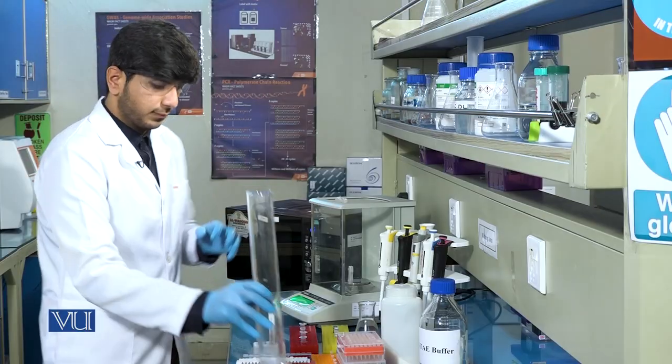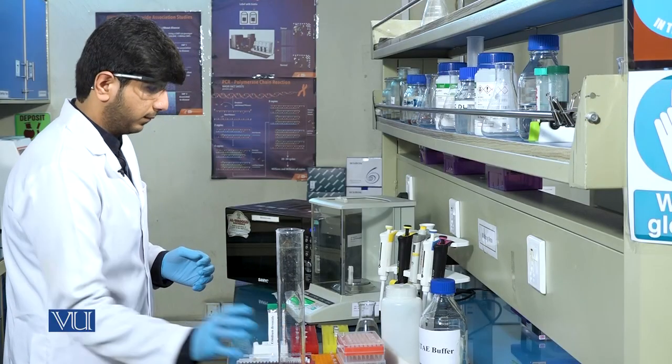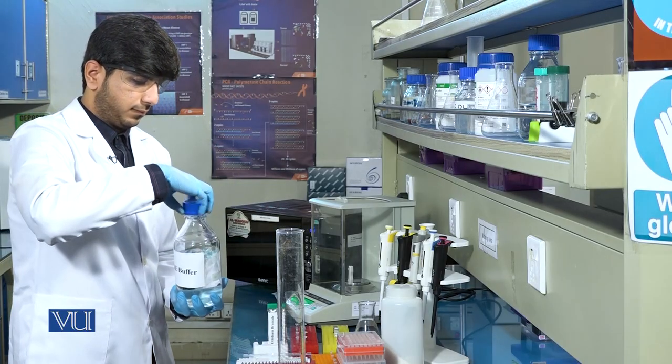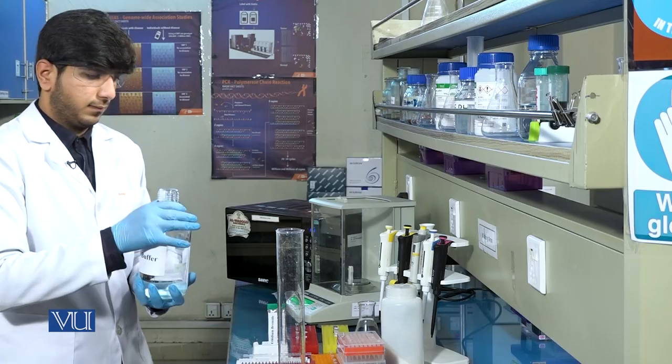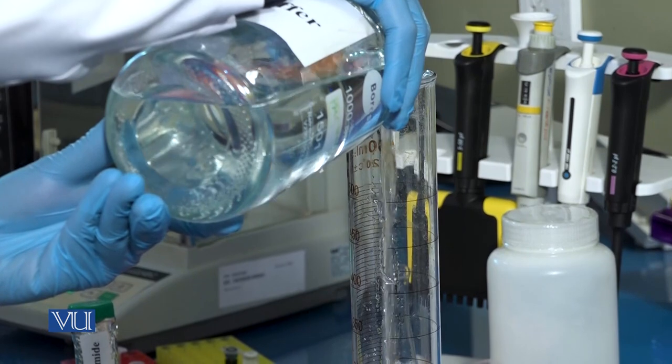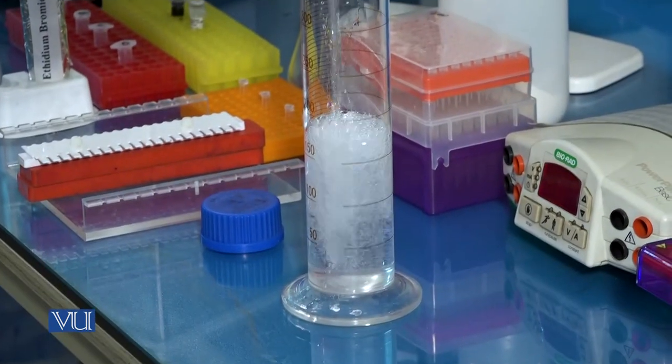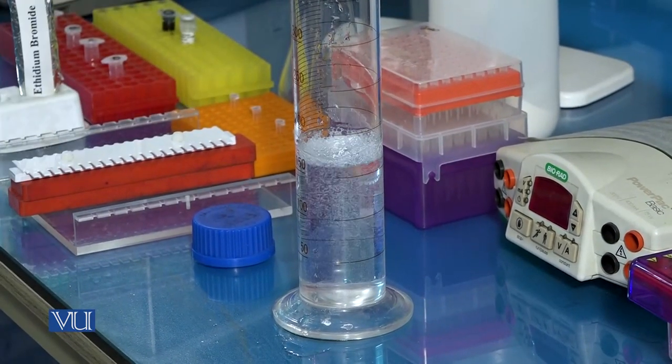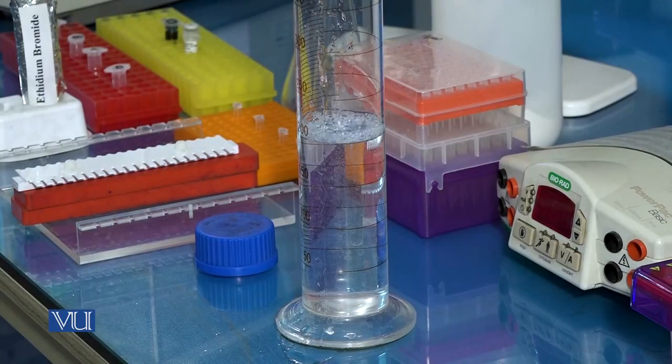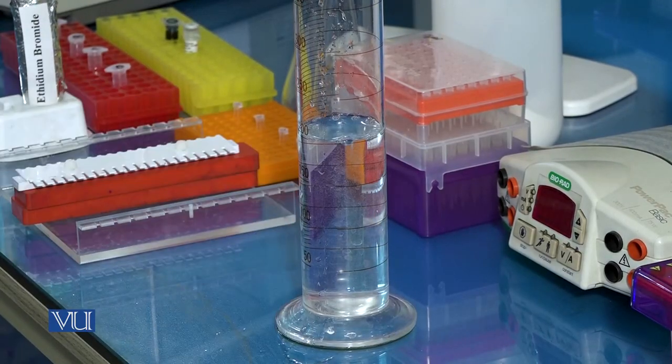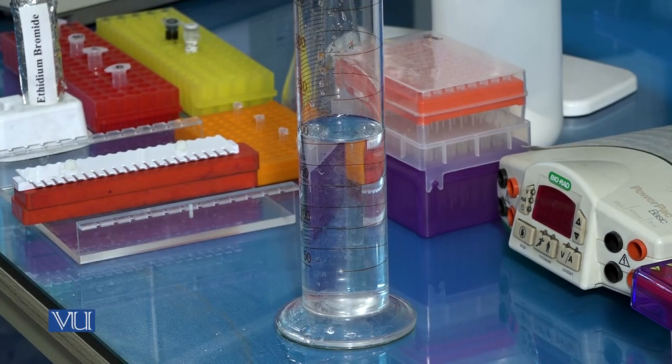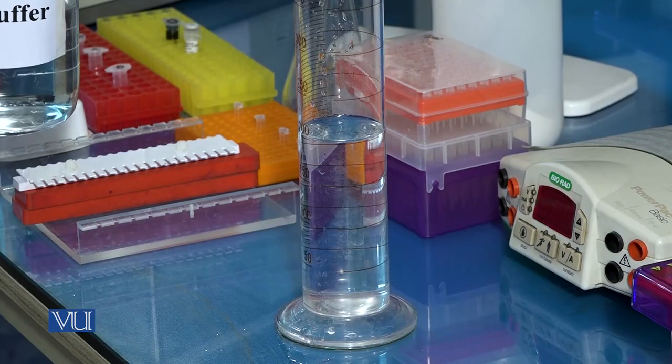Next, measure the 1x TAE buffer in the cylinder and add into the flask.